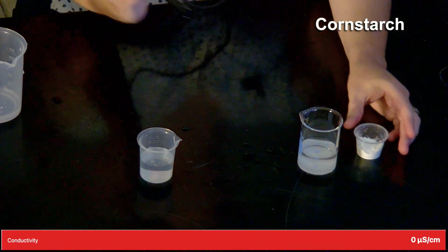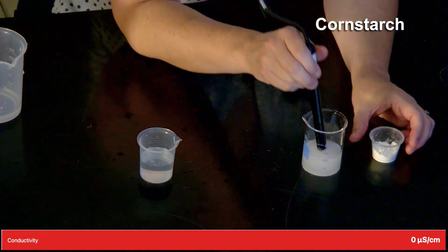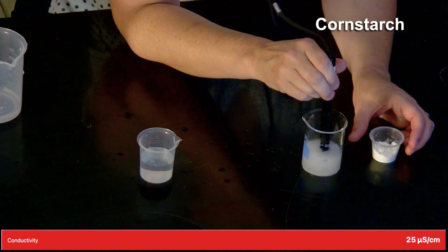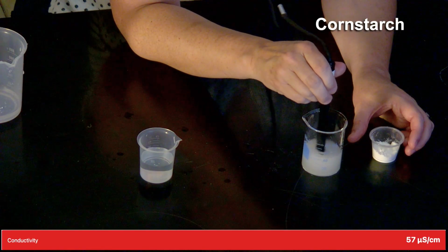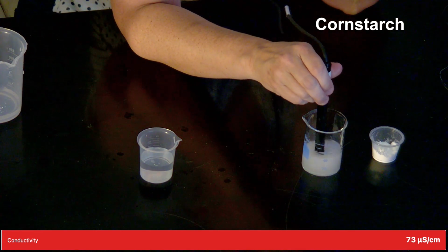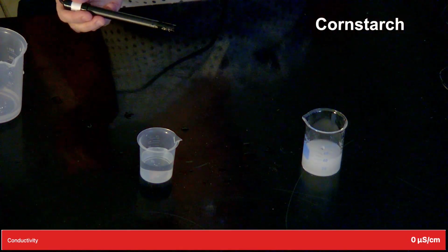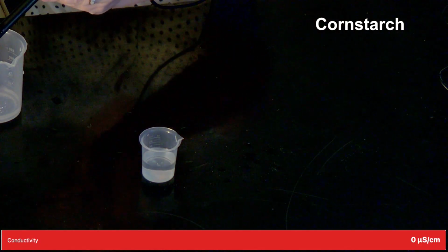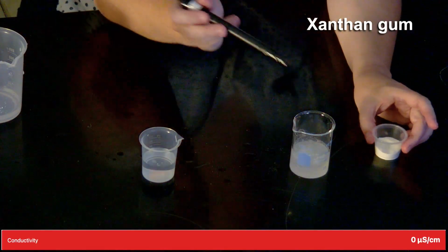Also a white solid, definitely more cakey. Xanthan gum is next. Also a cakey white solid.